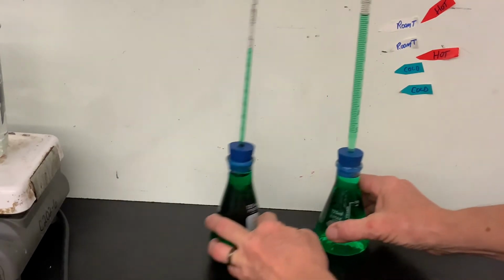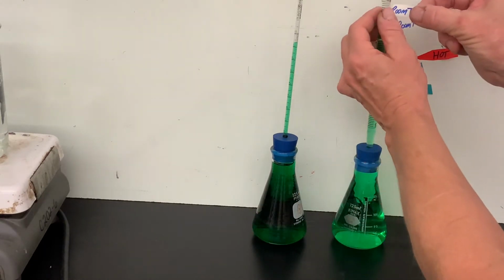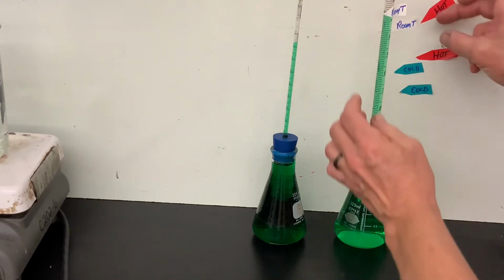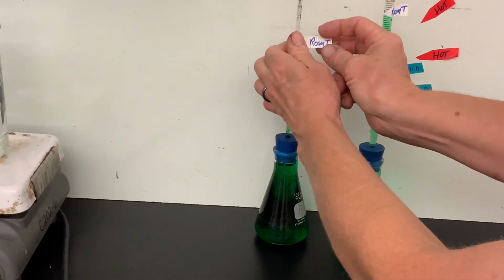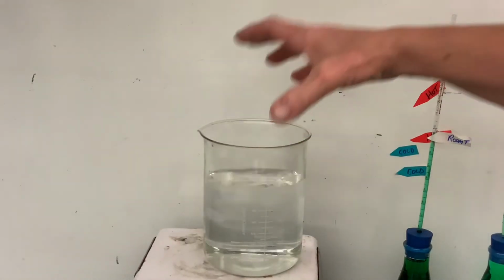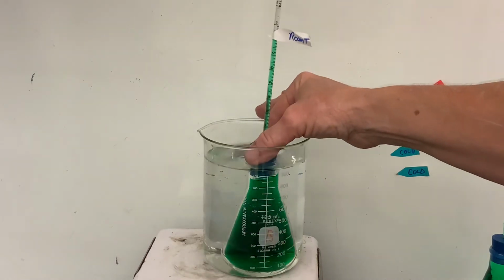So now I'll pull aside the others and actually use the two that I've set up for no really good reason except the food coloring is a little bit darker. And I'll mark room temperature on the one on the right, which has a wider glass tube, and room temperature for the one on the left with little pieces of tape. You should make your measurements and discussion with the flask on the left, the one that I use first.